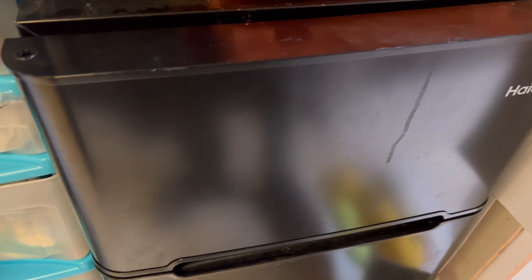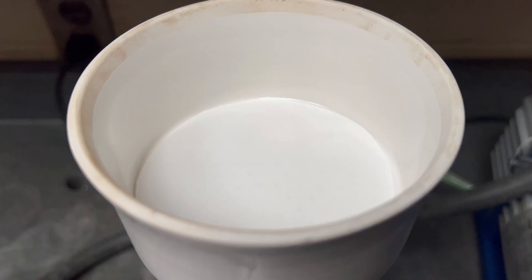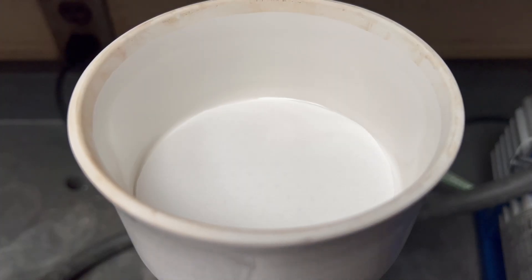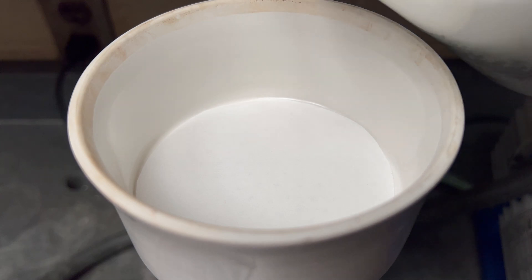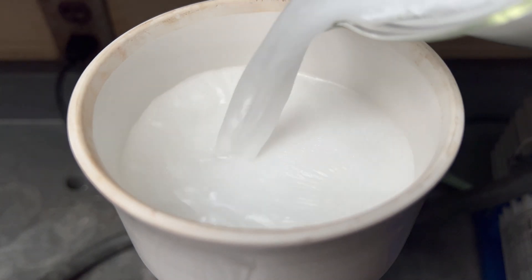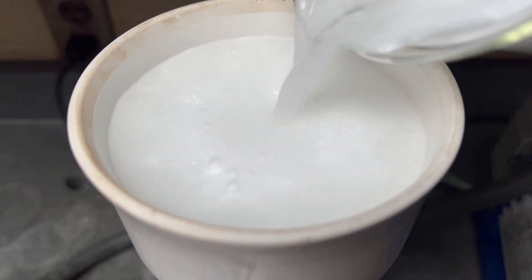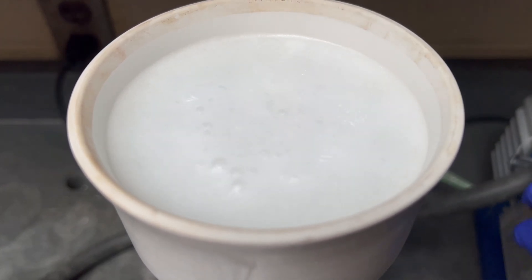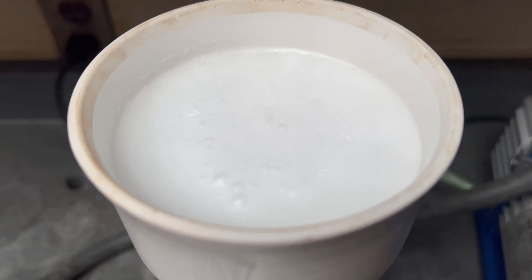The solution is then cooled in the fridge and then filtered once again. Once filtered, wash the crude product with ice cold water. Due to the precipitation and washings, any soluble impurities that were present will be washed out from our pure product of benzoic acid.